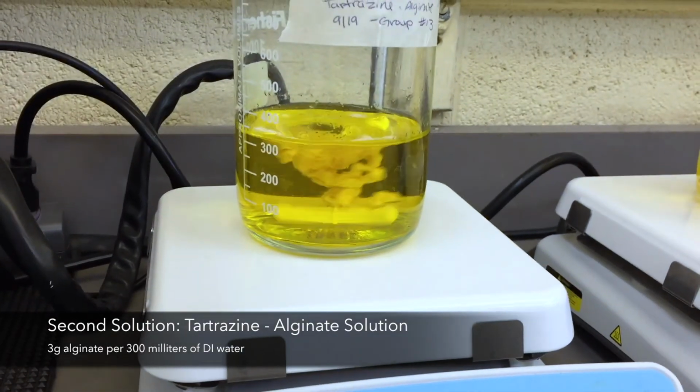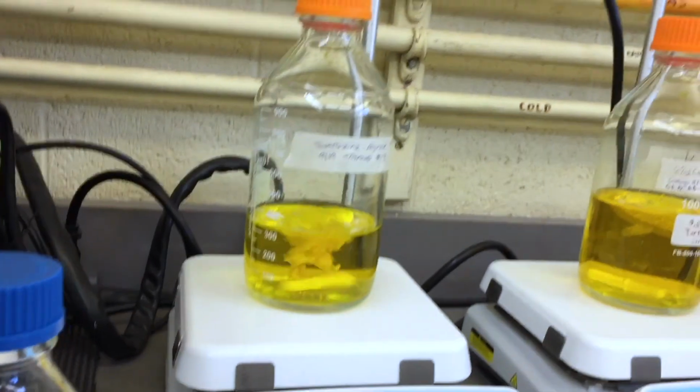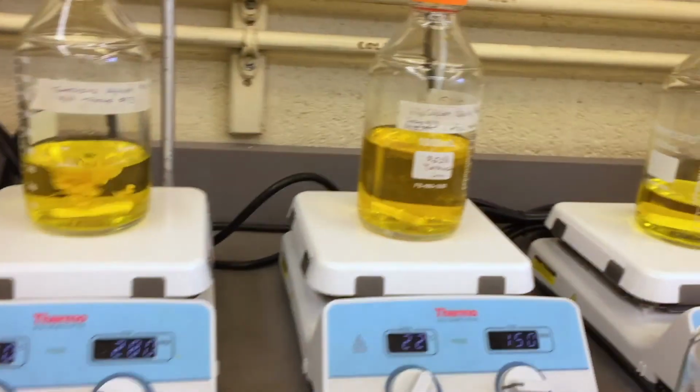The next solution that needs to be made is the alginate solution. To make 300 milliliters of this solution, 3 grams of alginate is added to 300 milliliters of the tartrazine stock solution. The solution is left to mix on top of a stir plate with a stir bar until all the alginate dissolves and there are no more clumps in the solution.